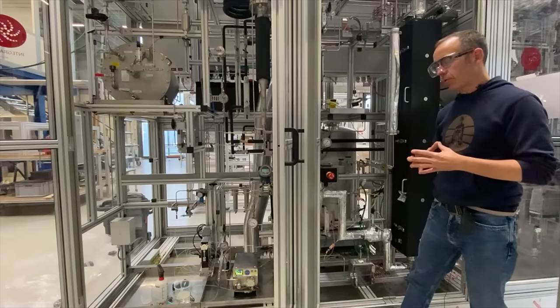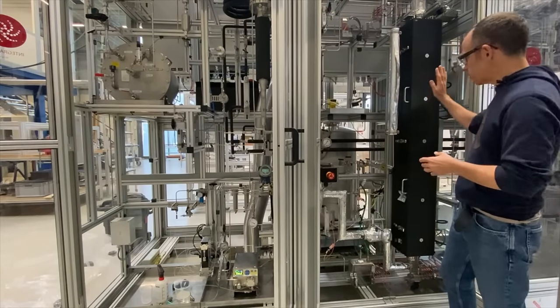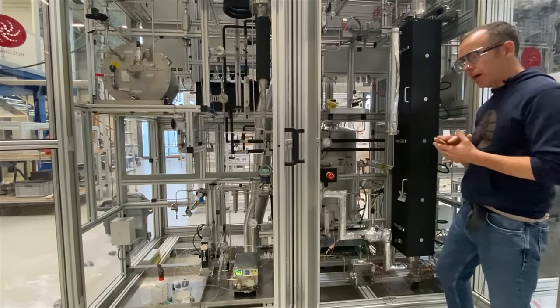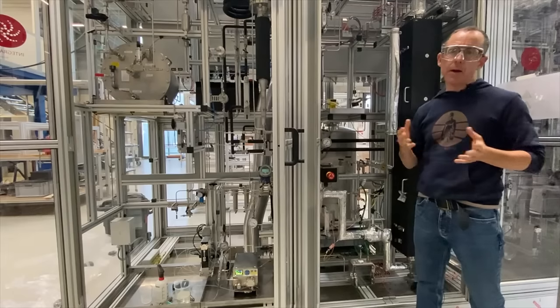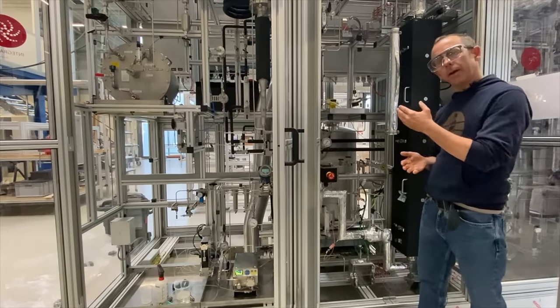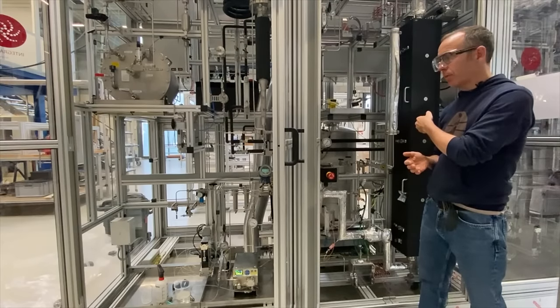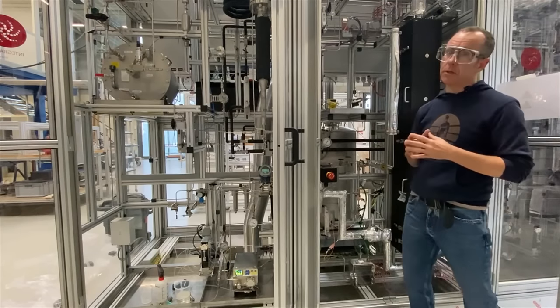In this case we have a three reactor system, though I can only show one module of it due to space constraints. This is actually one of the reforming reactors itself. The other two reactors are a second reforming reactor as well as an upstream hydrotreating reactor. The hydrotreating reactor is often used in the first step to remove hetero atoms like sulfur or nitrogen, which can be catalyst poisons for the CCR catalyst. We then go in reactor series configuration from the hydrotreating reactor through a stripper — where we can do intermediate sampling, for example — and then we continuously feed the product from that step into one or both of these CCR reactors.